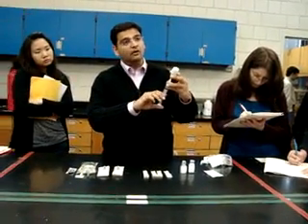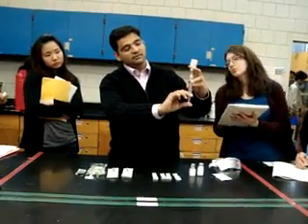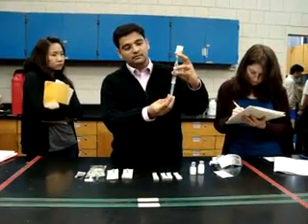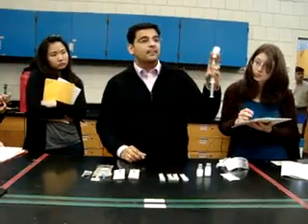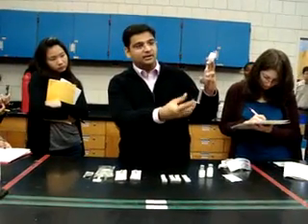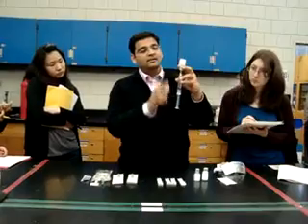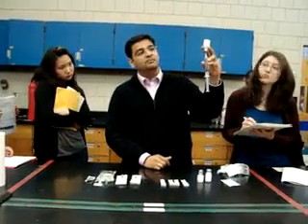You can go nice and easy — when you have to take a lot of volume, you don't have to go all the way in. You can just go nice and easy. Please do not touch the needle or the plunger. See the way I am holding the syringe — the examiner can never cut points because I am not touching the needle or the plunger. Hold these 2 fingers at the neck, remaining 3 here. If you hold it at the neck and need to take the full volume, my needle is above the liquid level, so with these 2 fingers I can push the bottle and draw whatever volume I want.